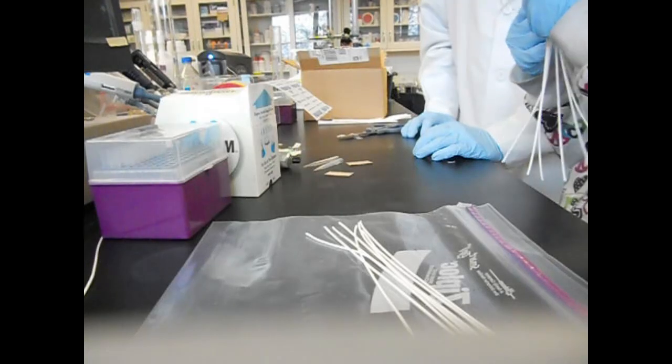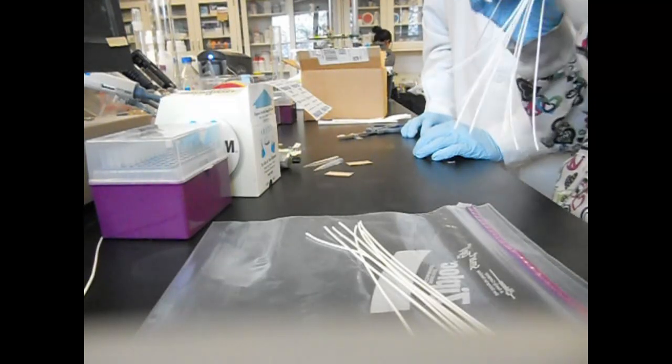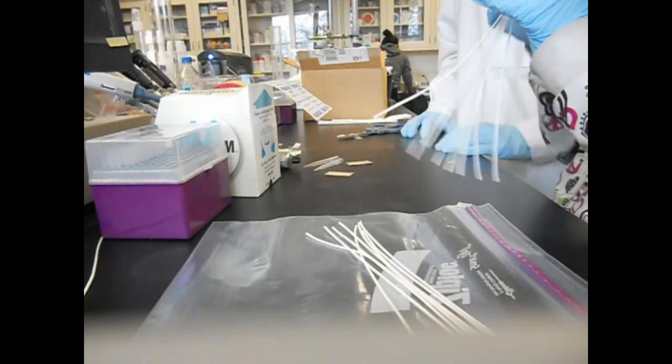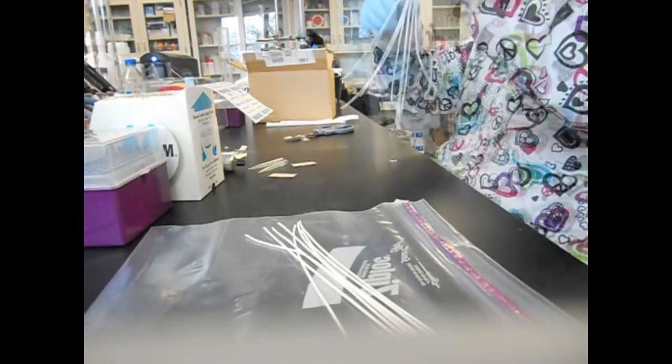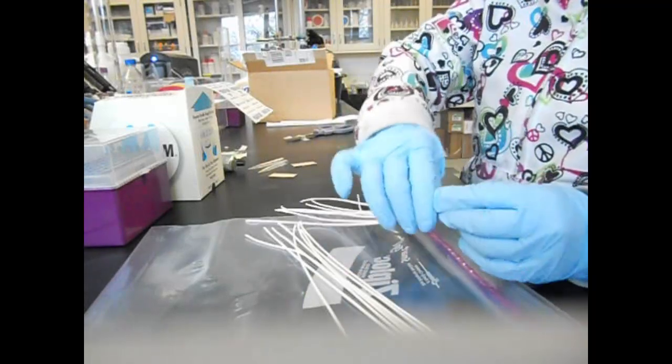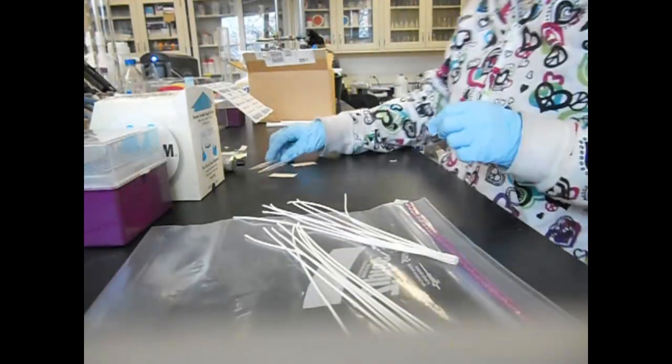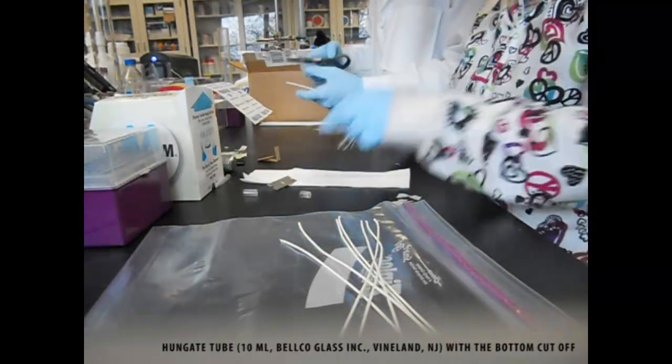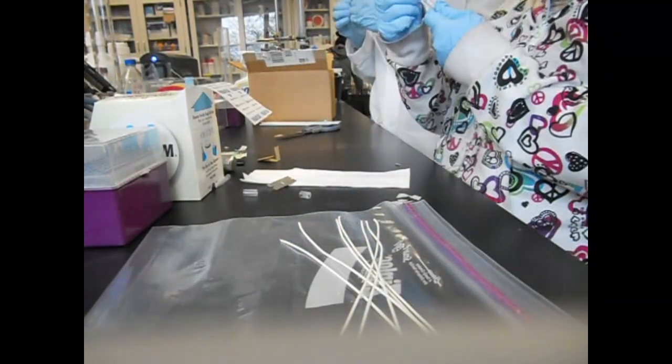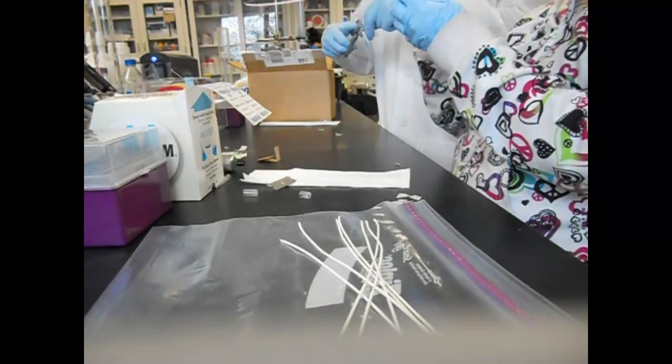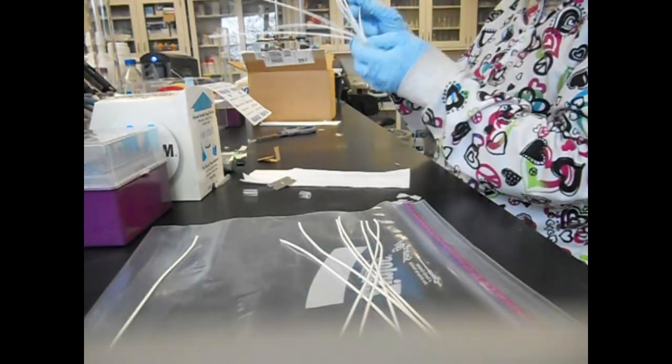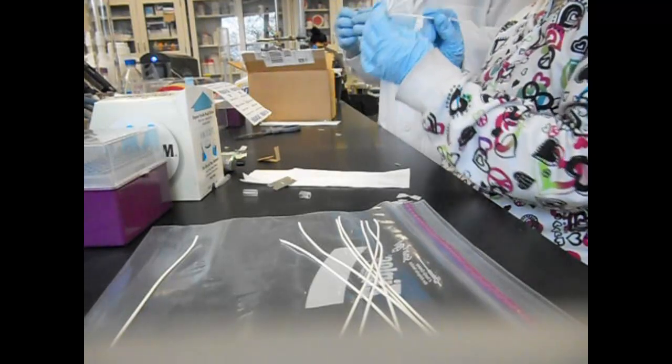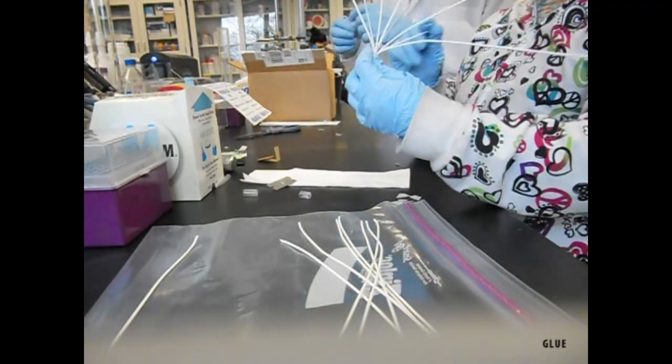So for our case, totally we just need eight. Then we just bundle them together. And next we separate them a little bit.